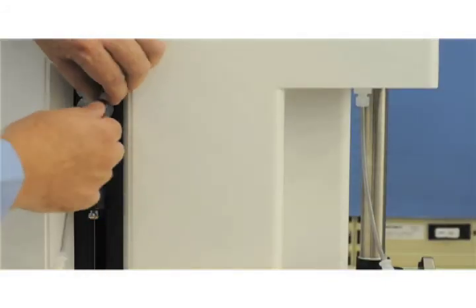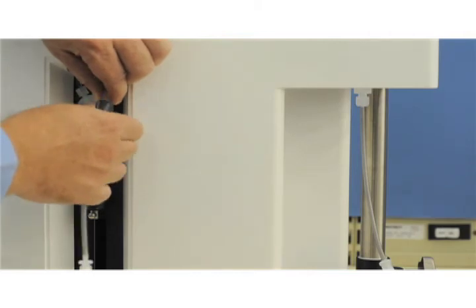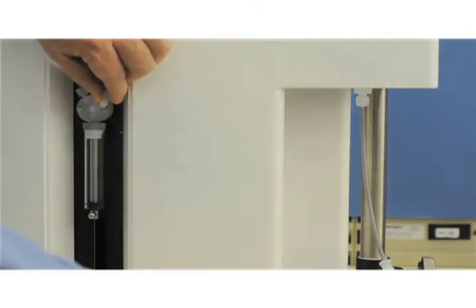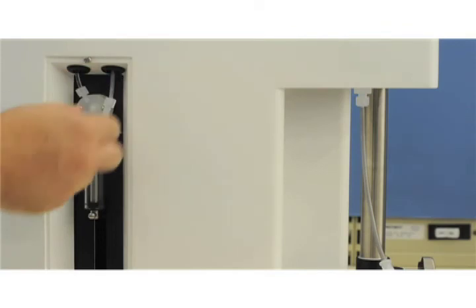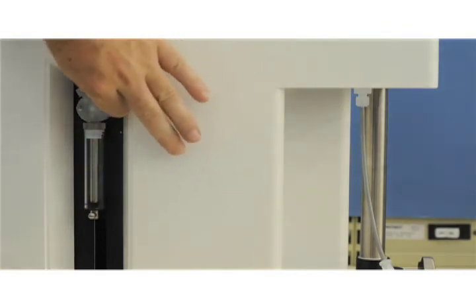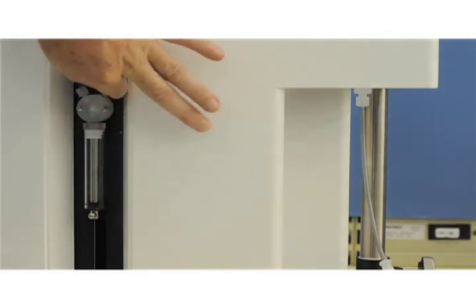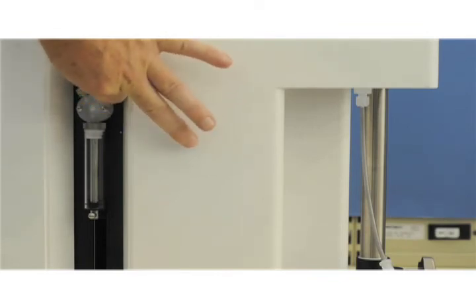Once you feel enough cleaning has been performed, remove the syringes. Removing the syringes in the recommended order will minimize spills on the lab bench. Disconnect the fitting from the tube union and reconnect it to the SLS-1000 syringe valve.